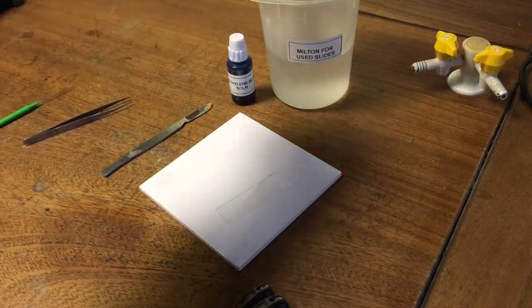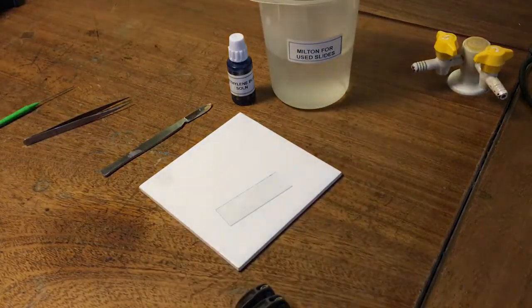Once I've finished with the cotton swab, it's disposed of in disinfectant for hygiene reasons.